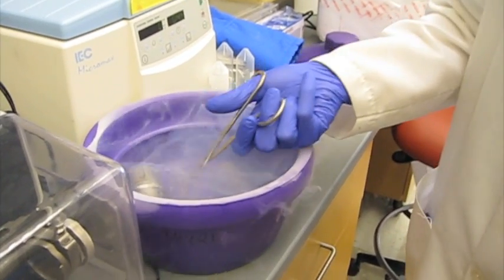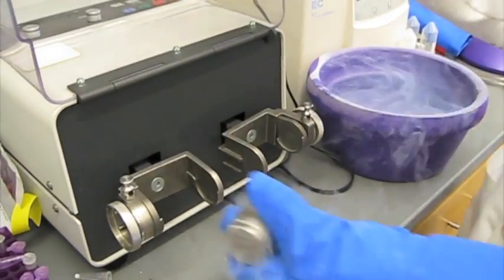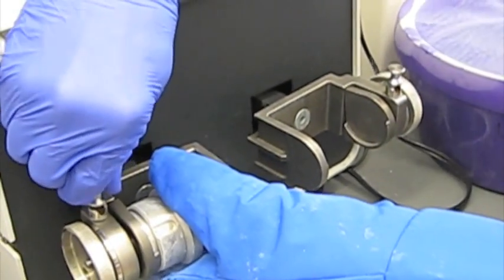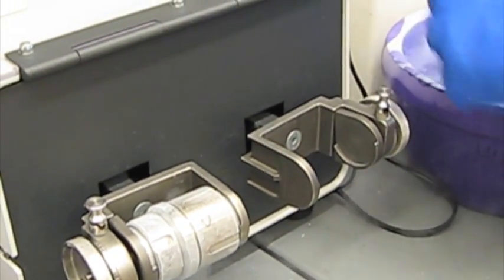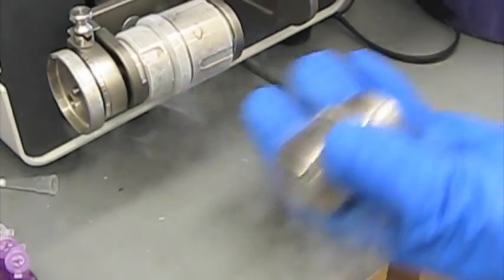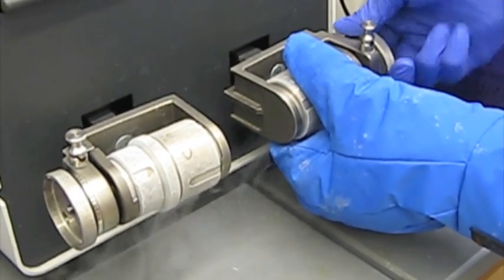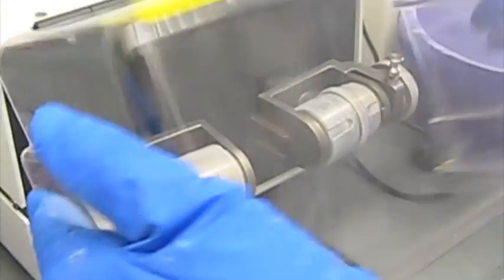We're ready to put it in the ball mill. We ratchet this down so it's nice and tight, and then we lock this in. We like to keep these symmetrical so that the short side here is pointing out, so we're going to balance it by doing the same over here. We'll tighten that down on both sides.